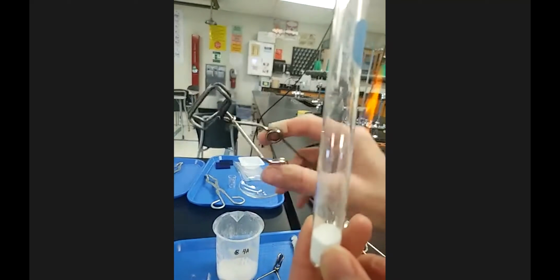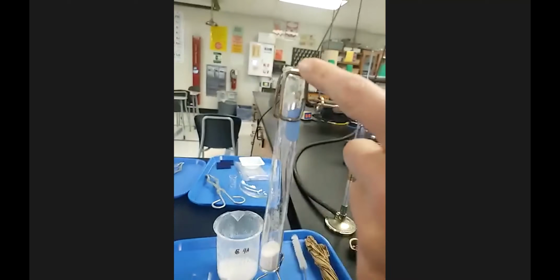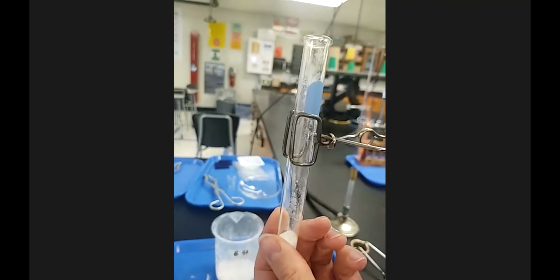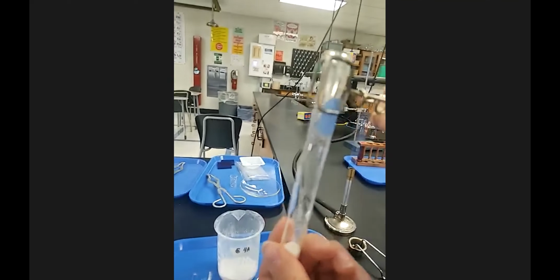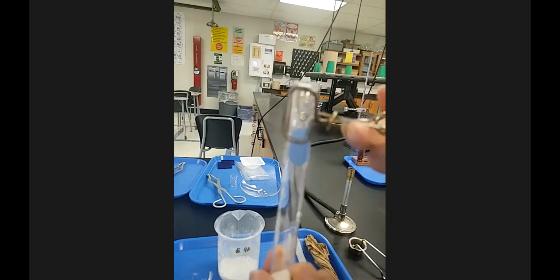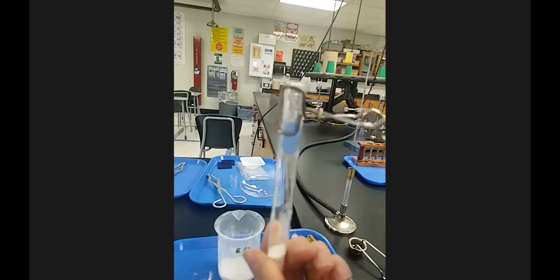It talks about this being held with a test tube clamp. So test tube clamp here. I'm going to open it and clamp it. Whenever you're heating something, you want the clamp at the top of the test tube. You do not want the clamp down at the bottom or even most of the way. You want it all the way at the top. And if your test tube has a lip, and these ones do, it won't slide off because of the lip on the glassware.